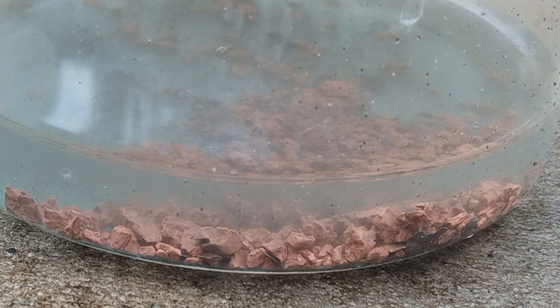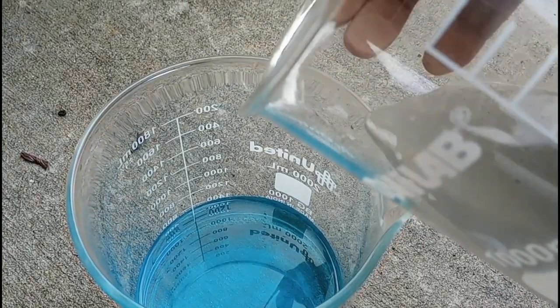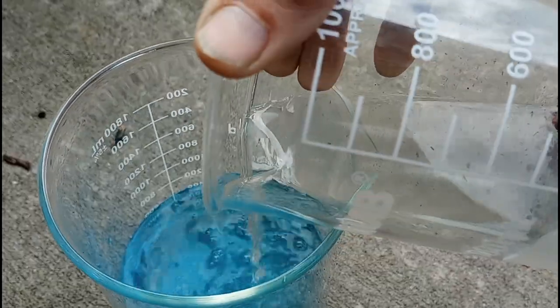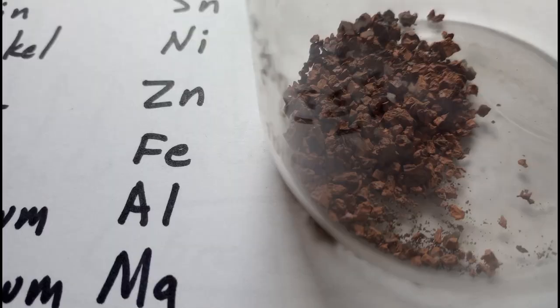The solution turned blue like it has been, and then it started to go more clear. This fairly clear solution — the undissolved pieces look like they are copper-plated. We're going to add the clear part of the solution to the other part of the blue solution that we had from yesterday. These are the washed and dried pieces of undissolved metal; in there were two visibly different types, so I separated them as best I could.